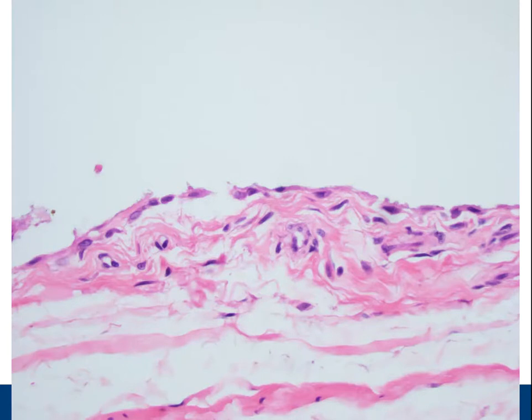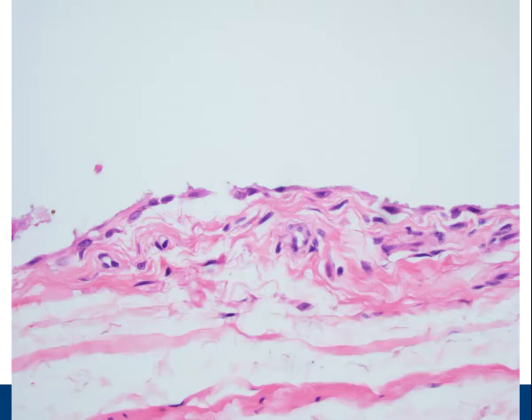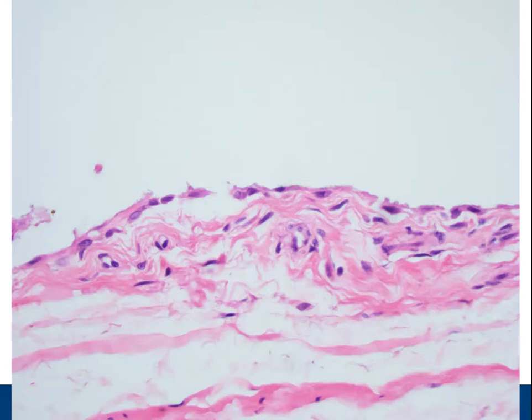This is the high power view of one cell layer of synovial lining synoviocytes. The synovial membrane is typically lined by a thin layer of 1-4 synoviocytes. Synoviocytes are fibroblast-like specialized cells located inside of joints. These cells play a crucial role in the pathogenesis of chronic inflammatory diseases such as rheumatoid arthritis.